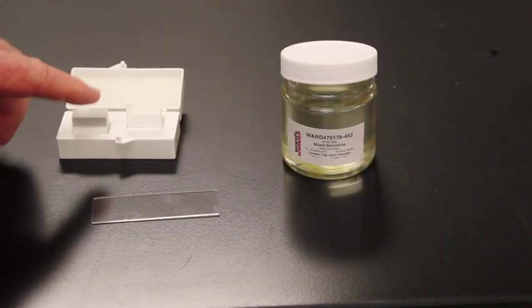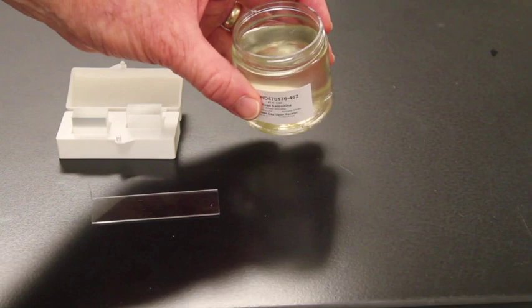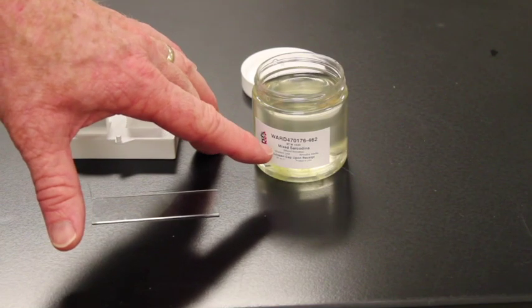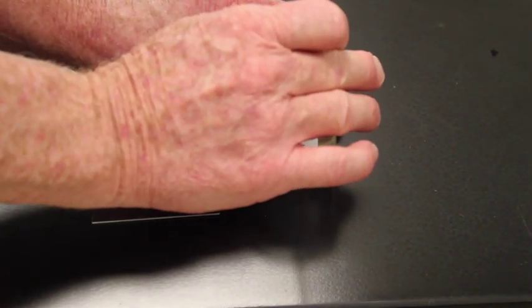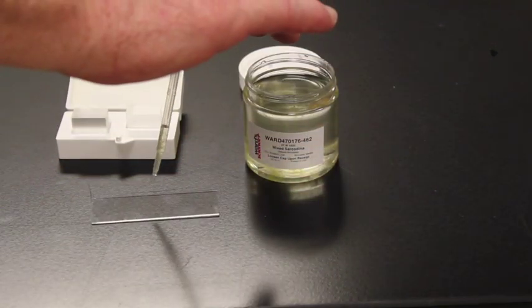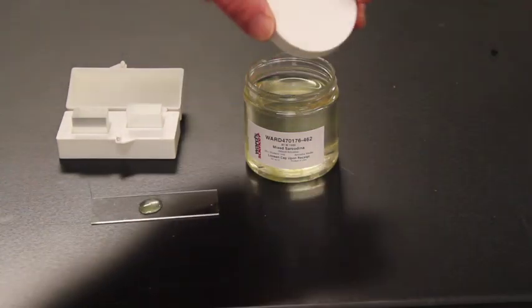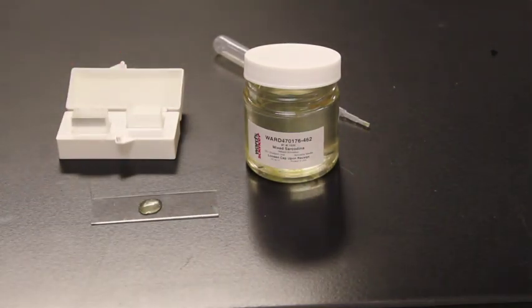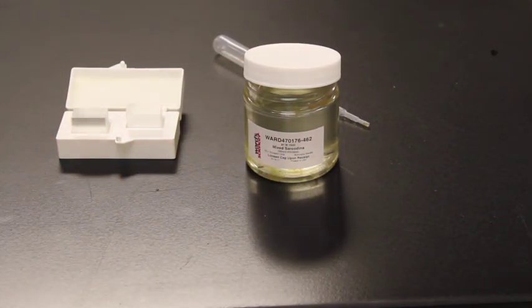We have coverslips here on a microscope slide that have all been cleaned. I'm going to take the lid off of this. The key thing about an amoeba slide is that the amoeba are all at the bottom — they're heterotrophic, so they're feeding on all of the debris. I want to go down into the bottom and gently suck up all the debris I possibly can, then put drops on the slide. We'll leave the lid a little bit open because these actually have to have air. I'll place a coverslip on the slide and have it ready to go.